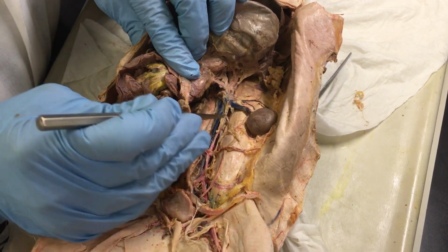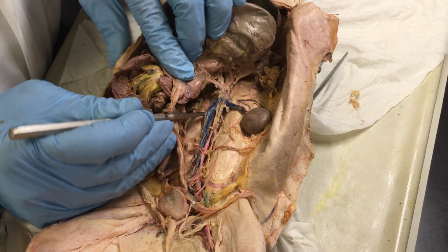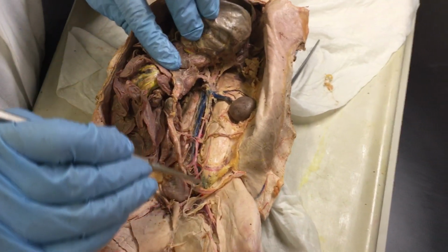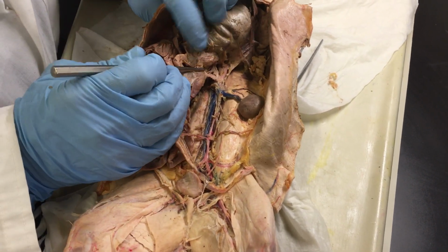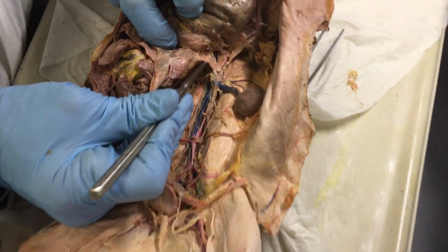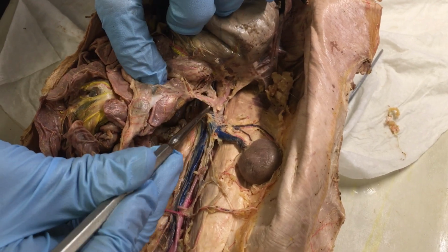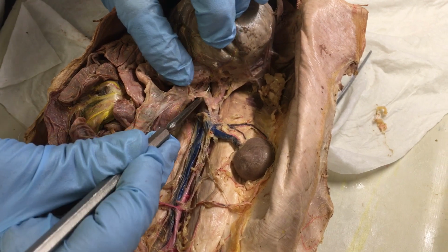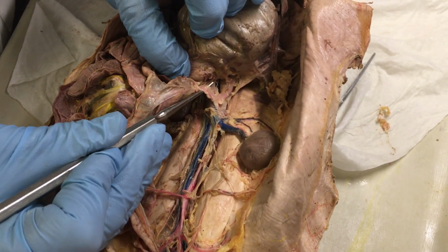And then the one on the side, the blue, would be the caudal vena cava, and this is the one that goes to the heart. So the aorta comes from the heart, and the vein will go to the heart. The branching that I want to show you from the aorta would be this first one here that goes toward the right, and it goes to the mesenteric area, the mesentery and the gastric. So this is called the cranial mesenteric artery.